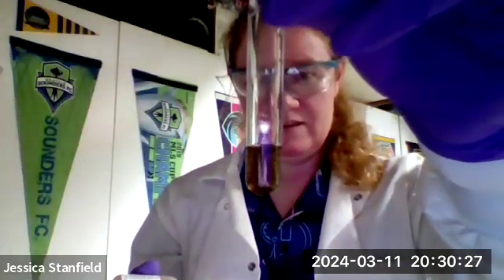Okay. Floating around there. Okay, so that is some iron(II) hydroxide. All right, so as you can see, our evidence for chemical reaction: we're getting some permanent color changes, we're getting some gas evolution by all those bubbles coming off that we can hear. Well, again, hopefully the mic picks it up, but it's fizzing sounding, at least on my end. We're getting a white precipitate, a brown precipitate. We're getting aluminum foil dissolving into solution.